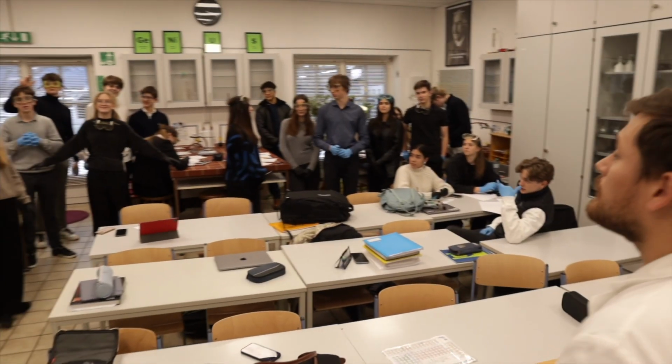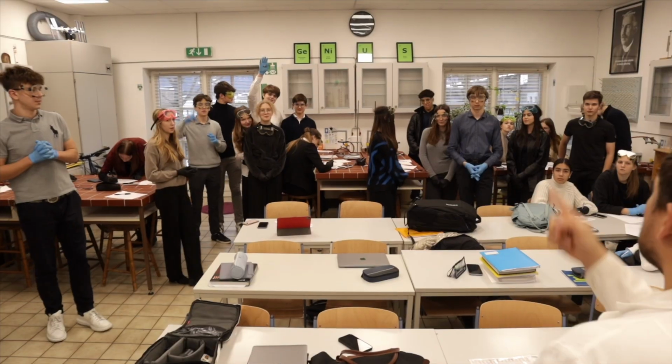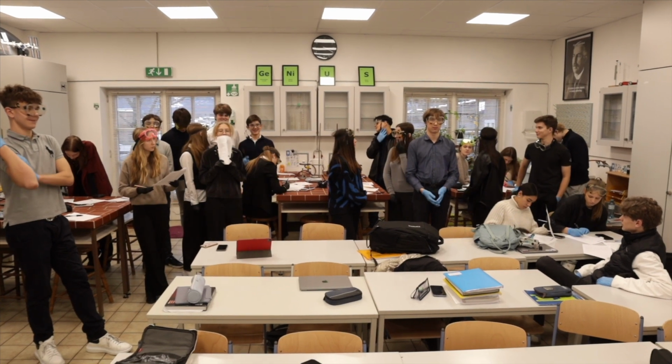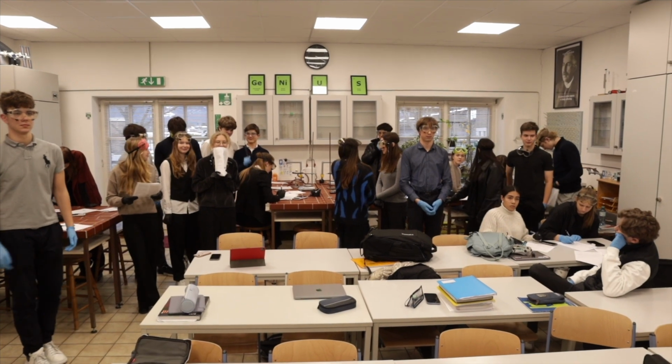Say again? You changed it from blue to white. Does anyone remember why? Tim? Because water is evaporating. The mass of the salt divided by the molar mass. Yeah, the mass of the salt divided by the molar mass. So a lot of you were right around 4.5, 4.6, 4.7 with your grams.